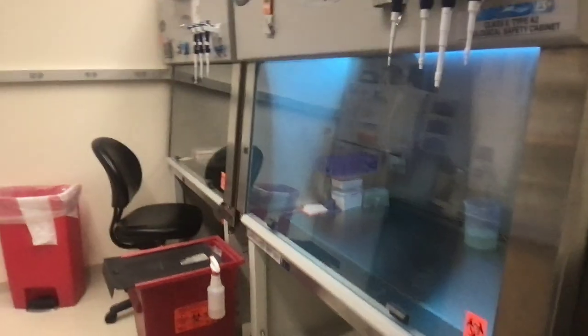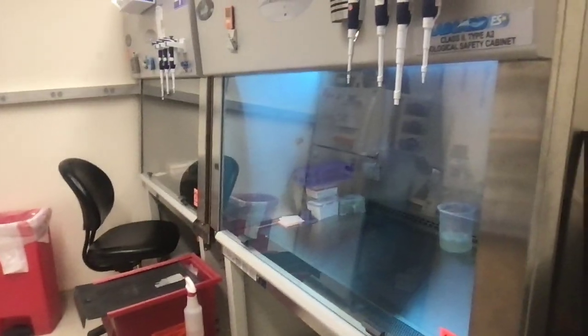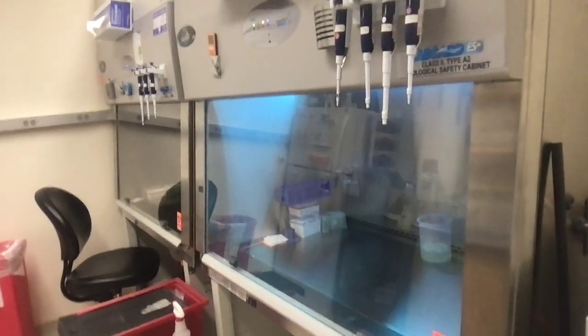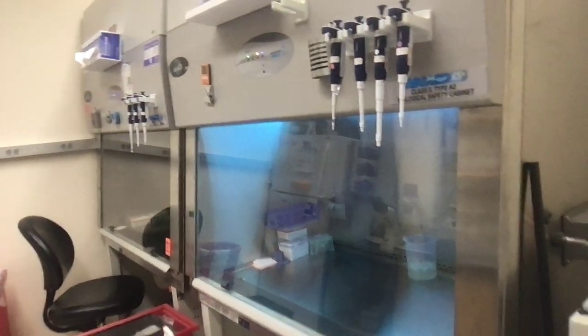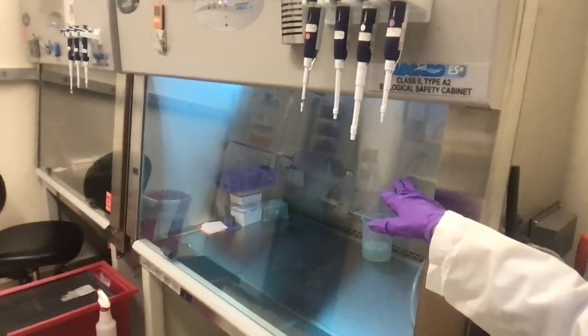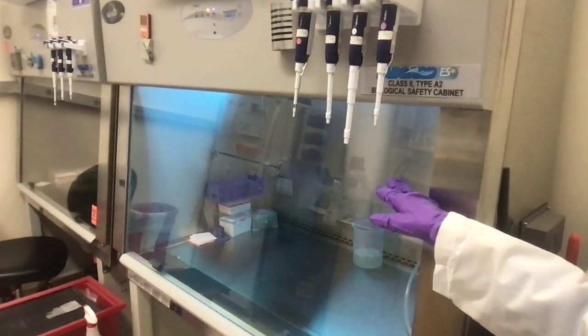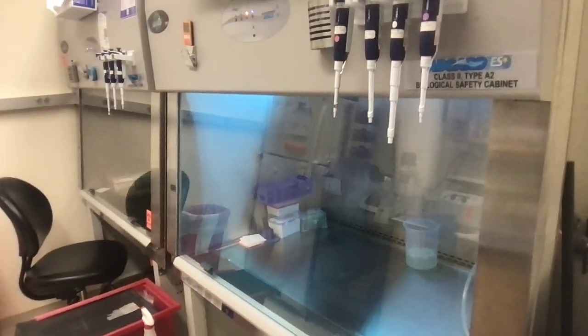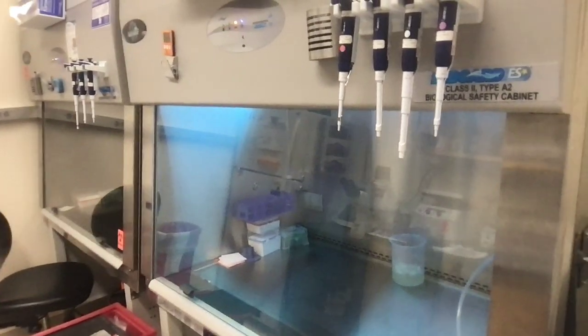What we have here are what we call biosafety cabinets, and they're important to use when we're working with anything that's potentially pathogenic, or potentially dangerous, because they keep dangerous things within the hood at all times. There's a purple glow in this cabinet, and that's because we're turning on a UV light right now, which is supposed to sanitize it and disinfect everything.